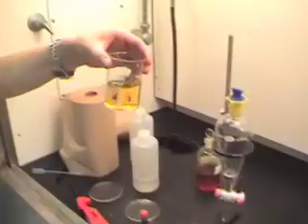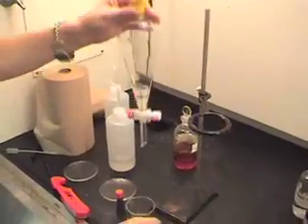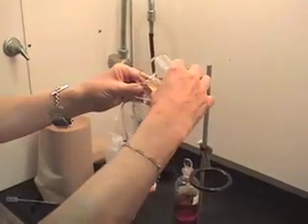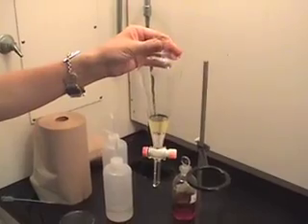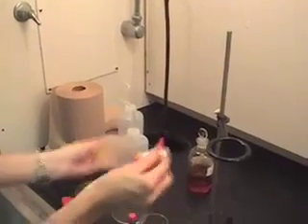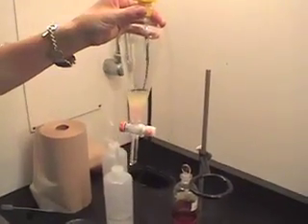The question is, what's on top and what's on the bottom? Do you remember the iodine formed through electrolysis? Iodine in water is a solution, and if I add it, the water ought to mix with the water layer so I can identify where the water layer is. It looks like the water layer is on top because it has the same color as what I just added. Now when I shake it up, you're going to see a pink color forming as it starts to separate.